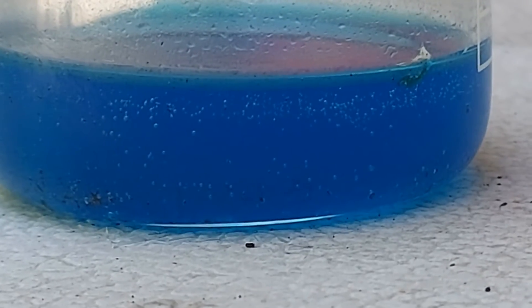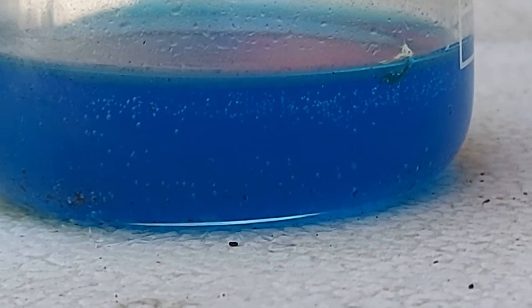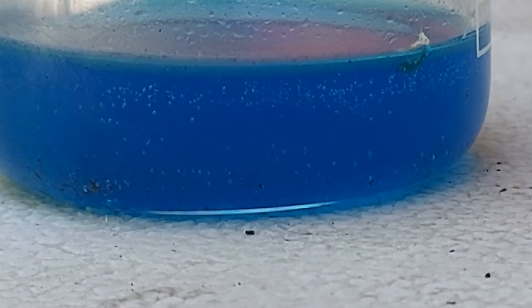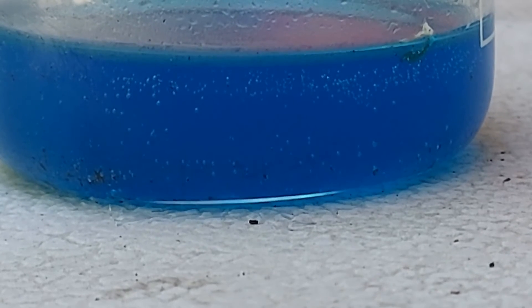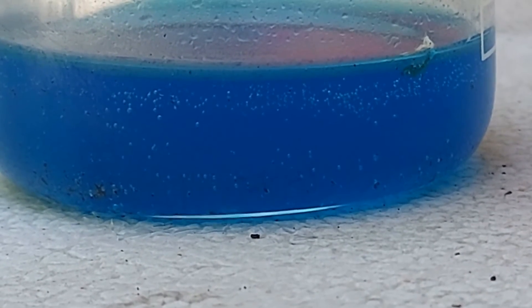Clearly the copper is gone — the bubbling has stopped and it's been completely dissolved. What happens next is all this liquid has to evaporate, which might take weeks or even months. When it's evaporated, there will be crystals left on the bottom, and those will be copper nitrate crystals — they'll be about this color.